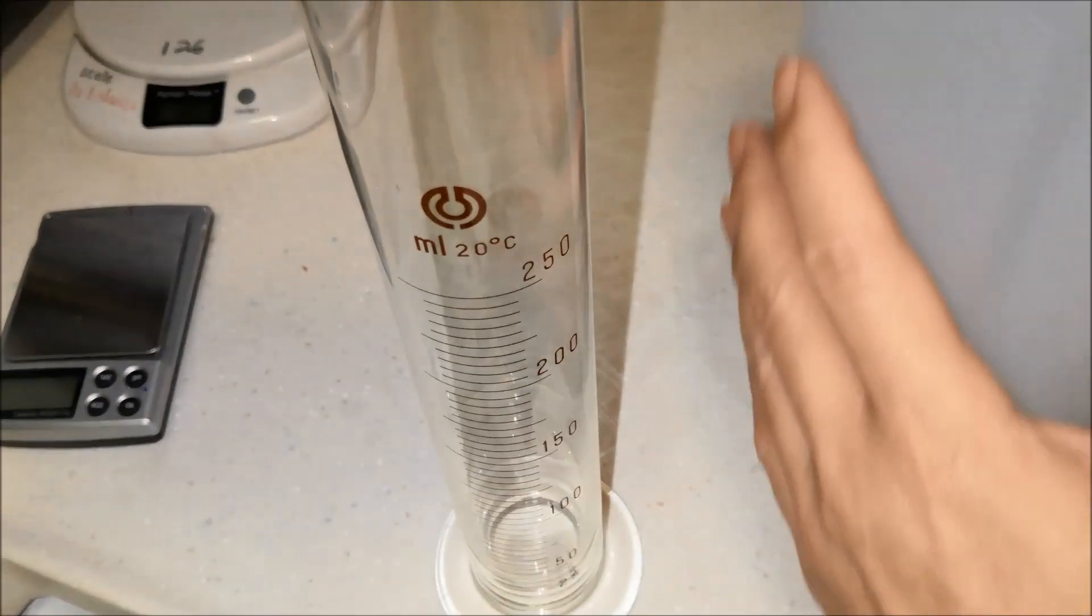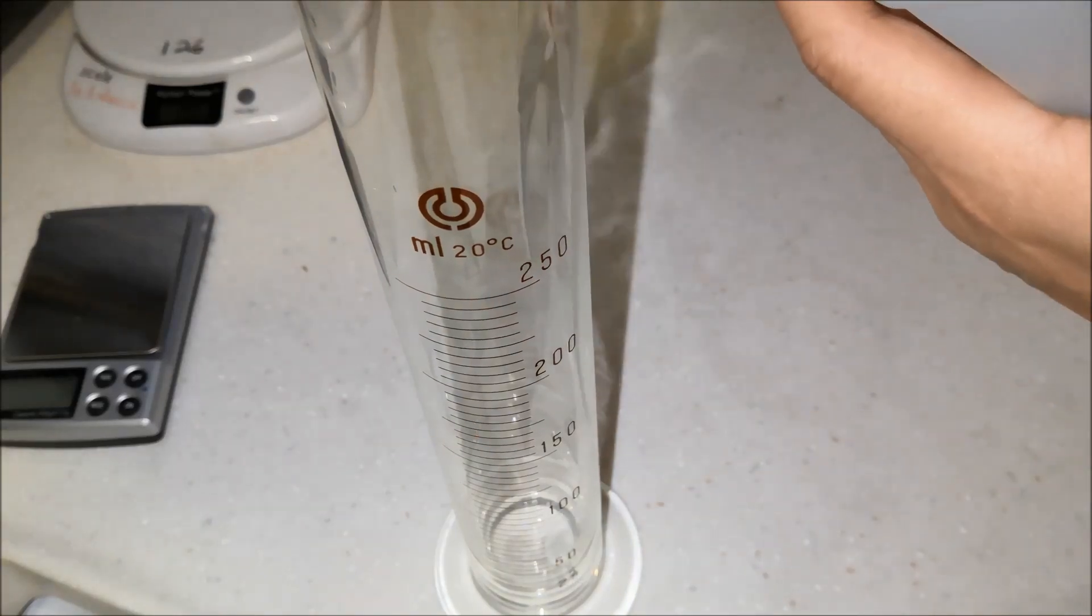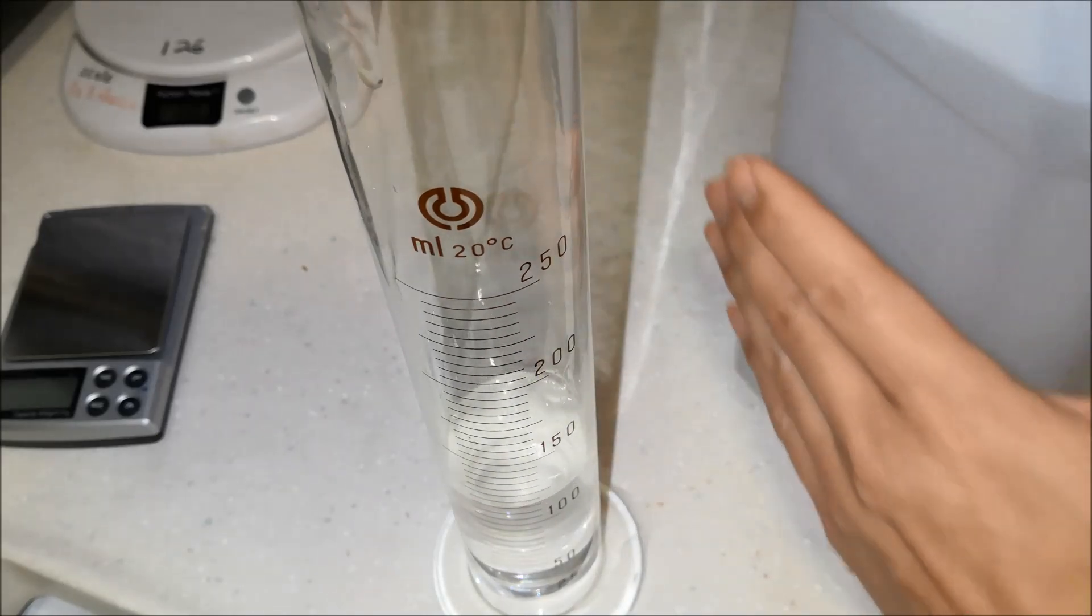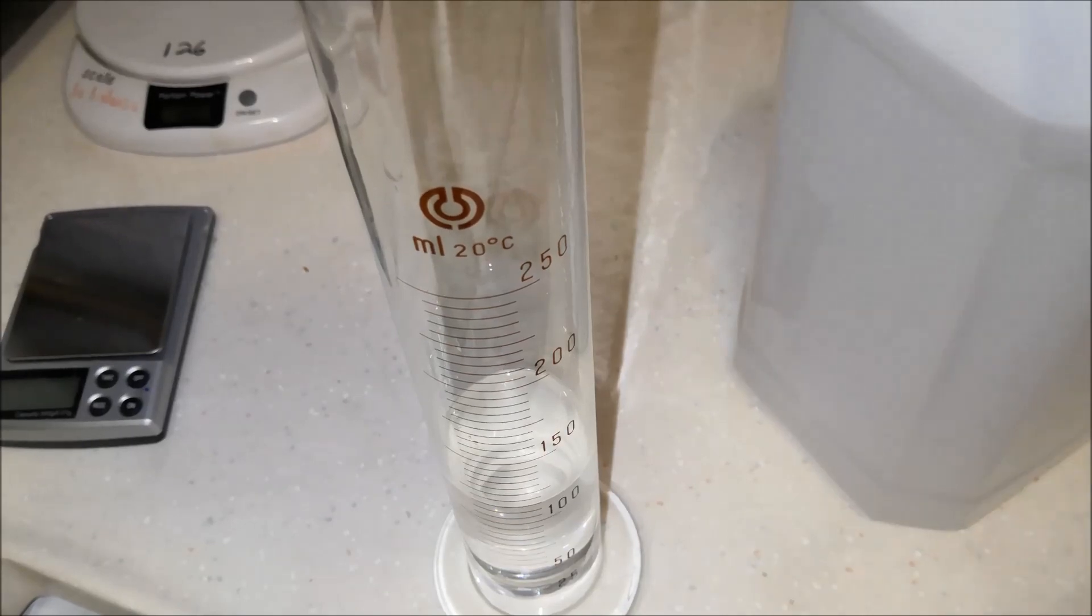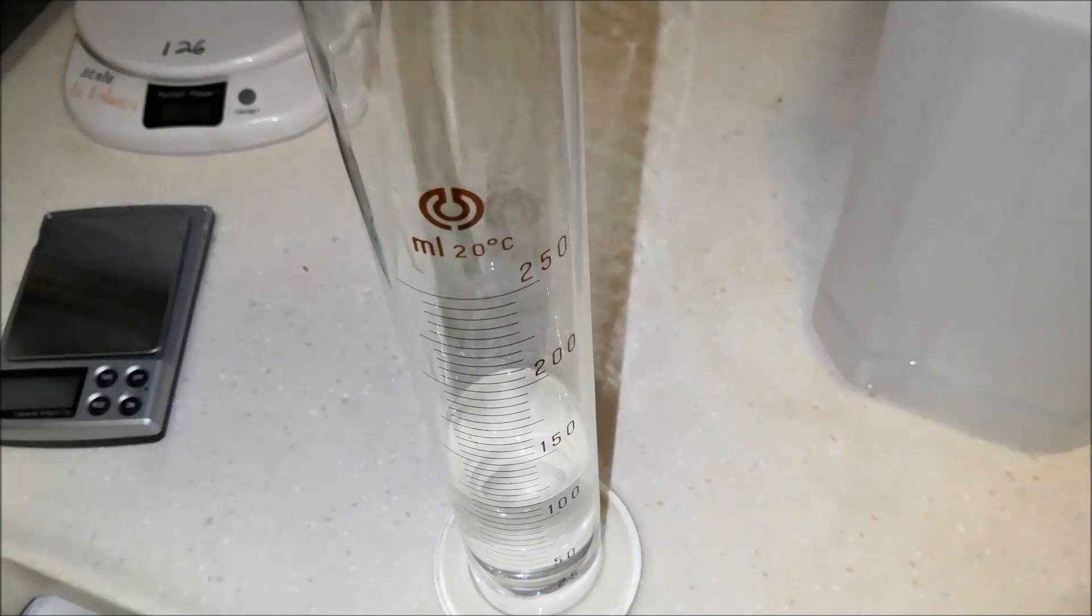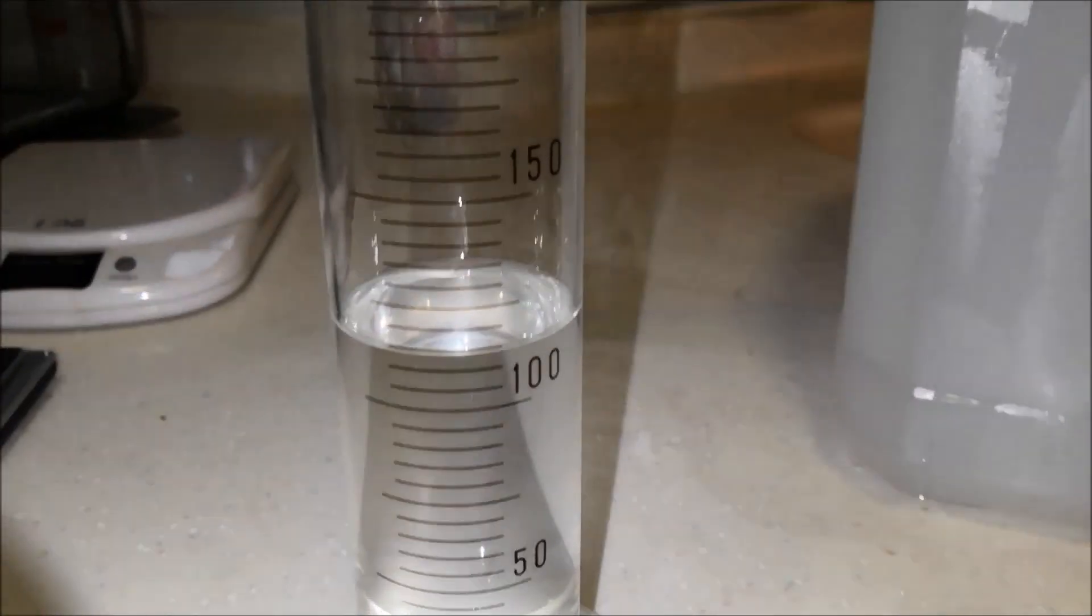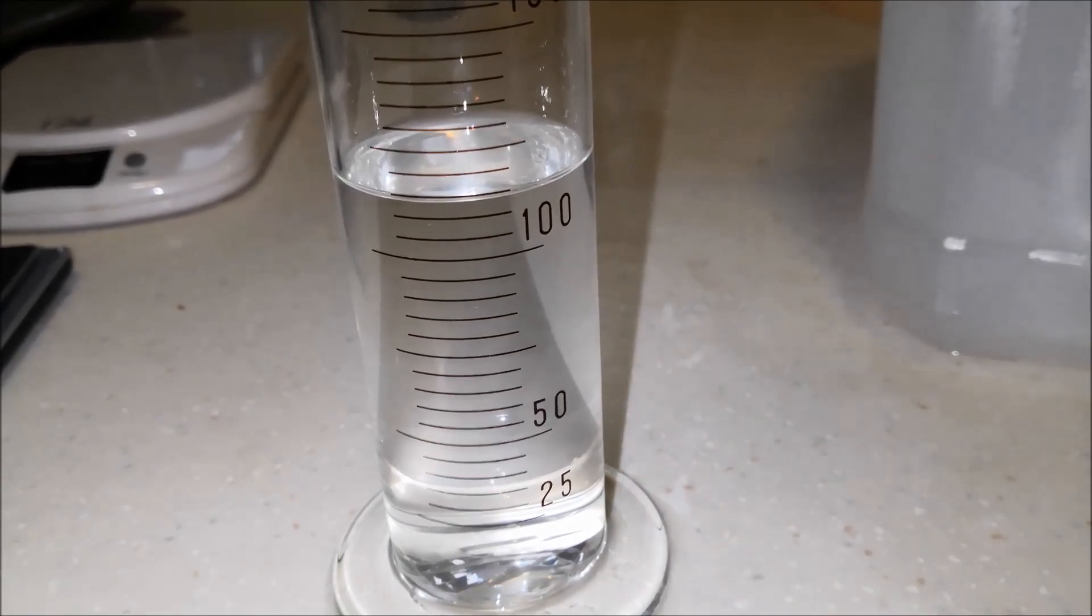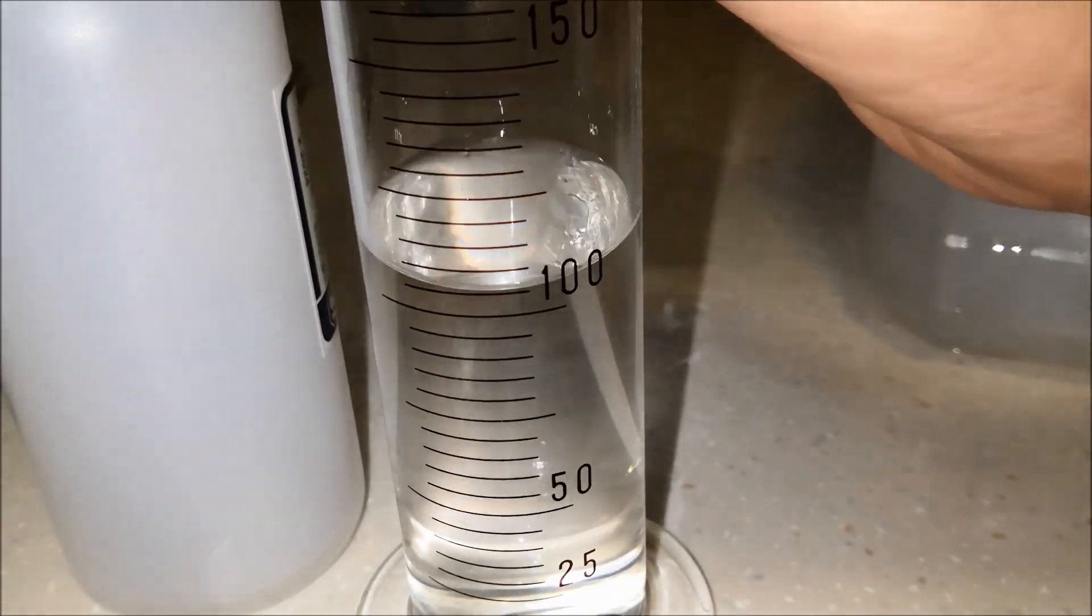Okay. Here we go. So now we're going to measure in 100 mls. Okay. We're definitely over on the 100 mls here. Let's recap this. Close it up. Yeah, we're definitely over. Not a problem. I'm going to pour some, I'm going to decant some out into another container.